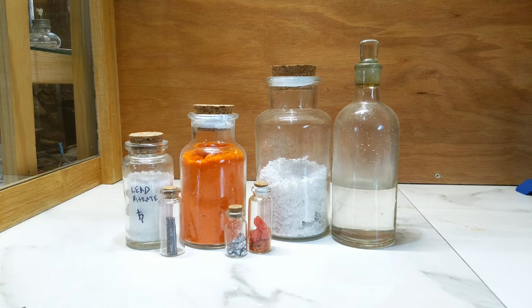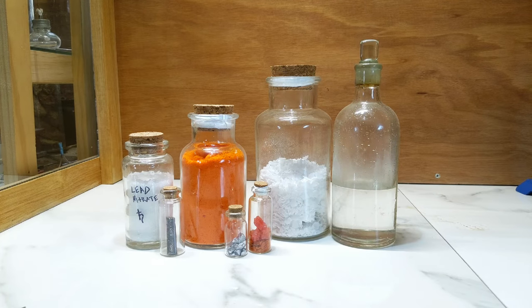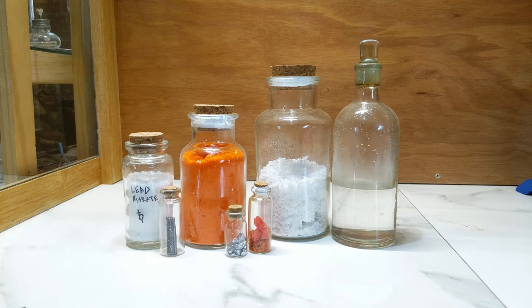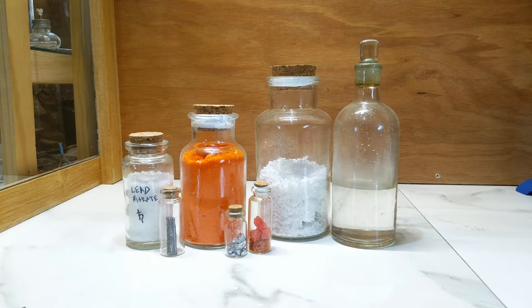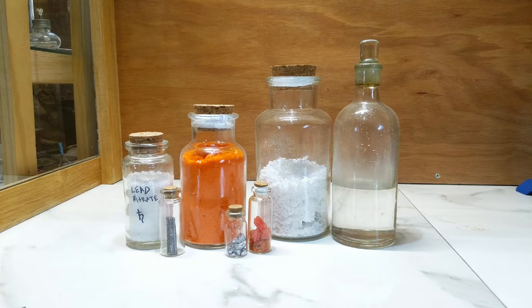Here we have in front of us the prima materia for today's experiment, which we'll be looking at the beginning of a series on chromate-based pigments. So today's first task is to produce chrome yellow.